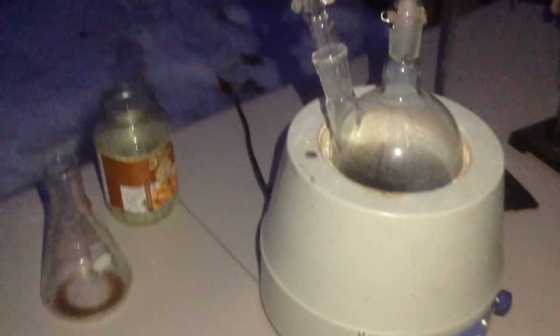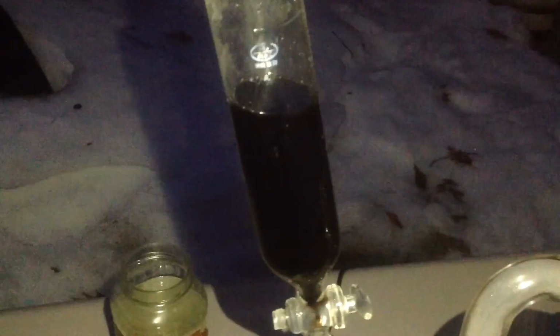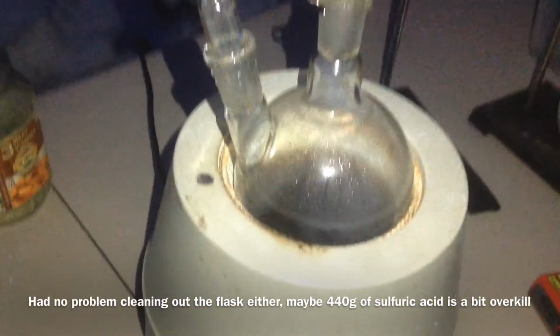I started this project at like 12, I think, and it's currently 6:04. So yeah, this took a long while. I didn't use all my sulfuric acid, luckily. For some reason, all the potassium nitrate reacted, so I'm happy about that. I'm able to save a little bit.